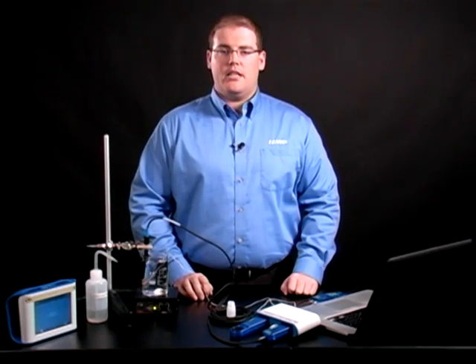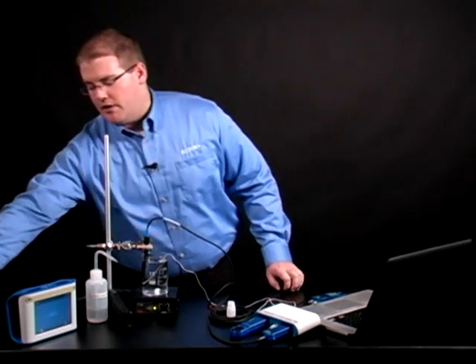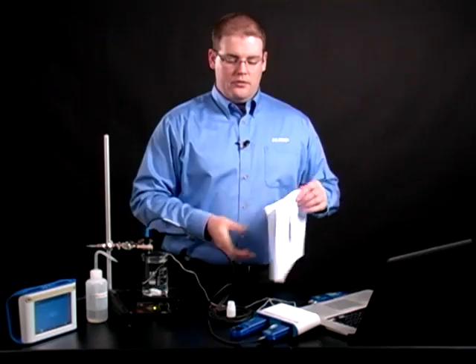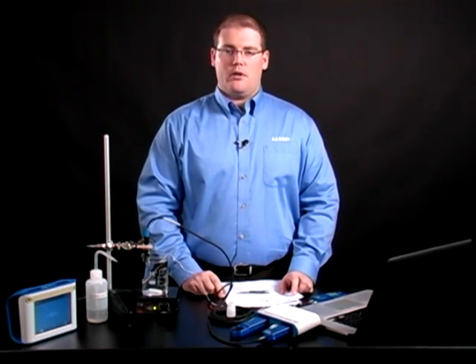Next, we need to find the calibration value. This can be found in the dissolved oxygen sensor manual in Appendix C. To find the value, we need to know the actual barometric pressure as well as the temperature of our water sample.